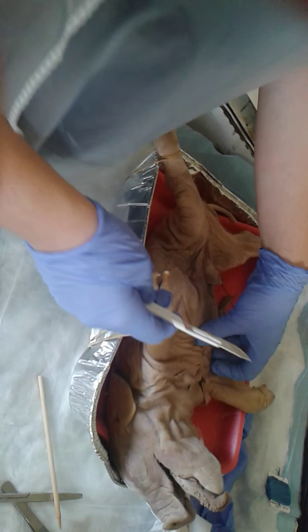I don't think I did that right, but I will just continue where I left off. Oh, this is gross. It's really hard to do with one hand. I made two cuts laterally at the forward nose part. Notice a thin sheet of muscle separating the anterior thoracic cavity from the more posterior abdominal — this is the diaphragm.